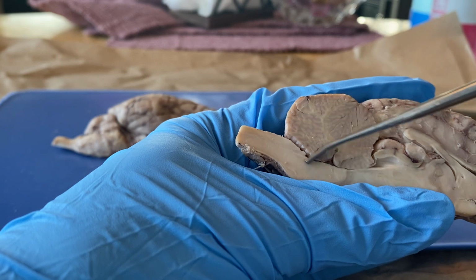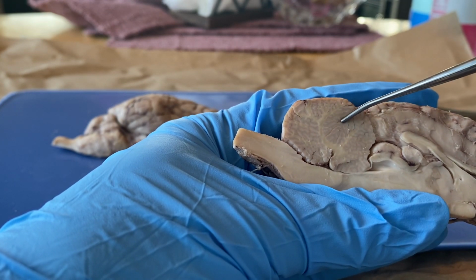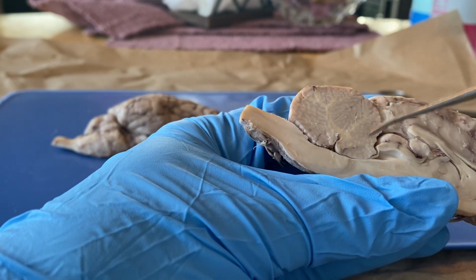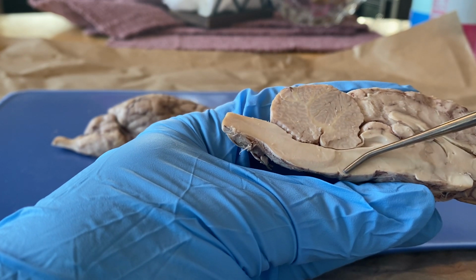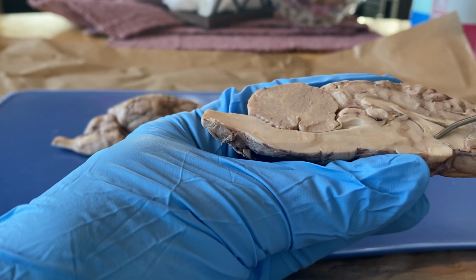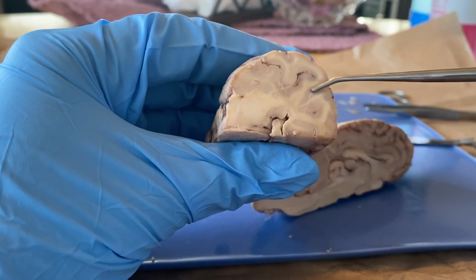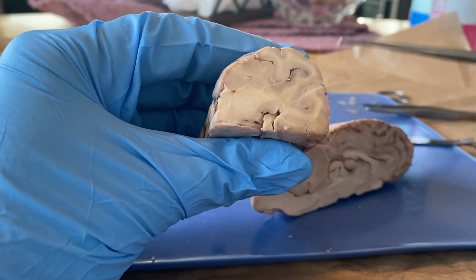If you look at the cerebellum split in half, these white lines that branch off are called white matter. That is essentially just bundles of myelinated axons. This area is the midbrain. It's a passage for the cerebral cortex. Then we have the hippocampus over here, which is learning and memory. And then if we take this apart, the darker areas right along here is gray matter, and those contain neurons.